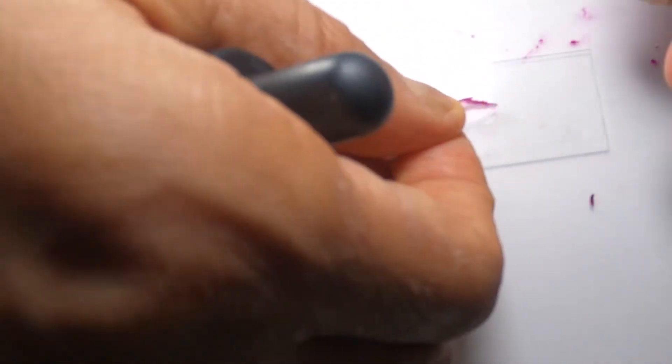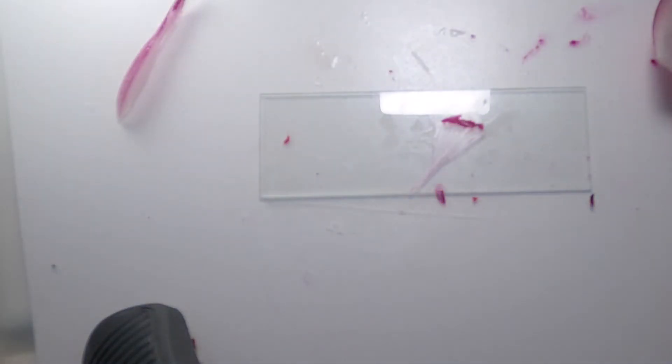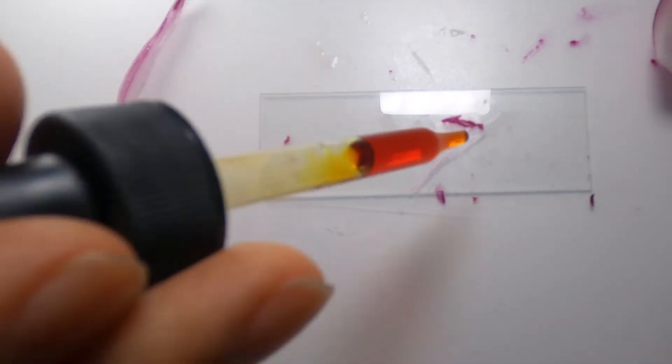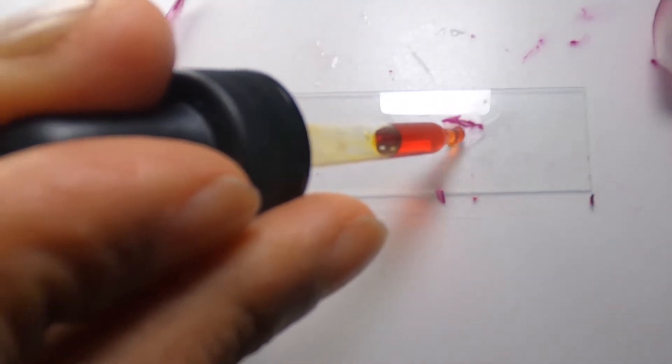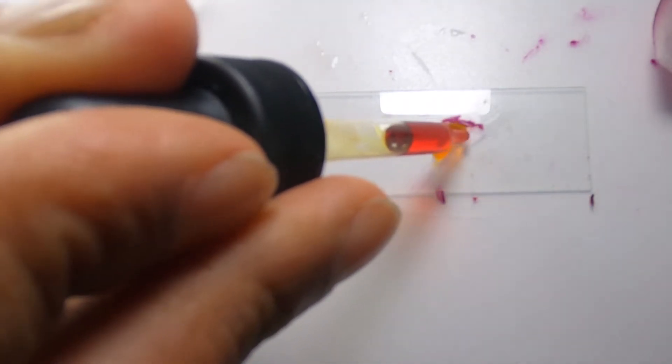We put this layer on the slide. The stain we are going to use is iodine, because these cells are almost colorless. The iodine is going to color these cells properly. Then we put a cover slip on top, and we can take these cells under the microscope.